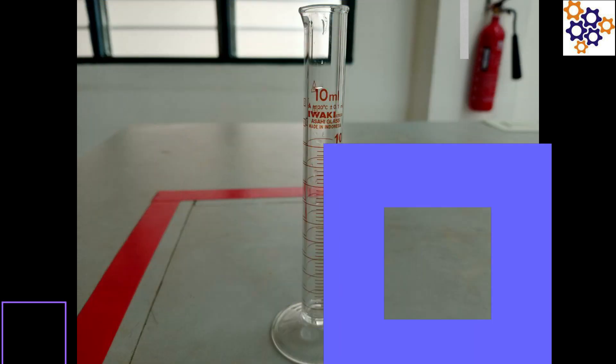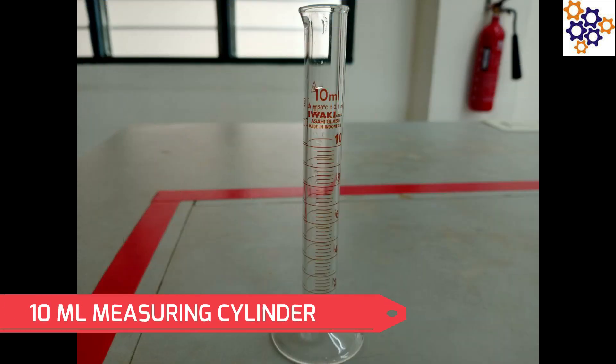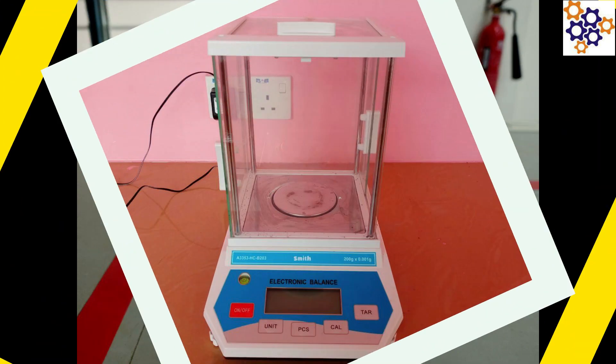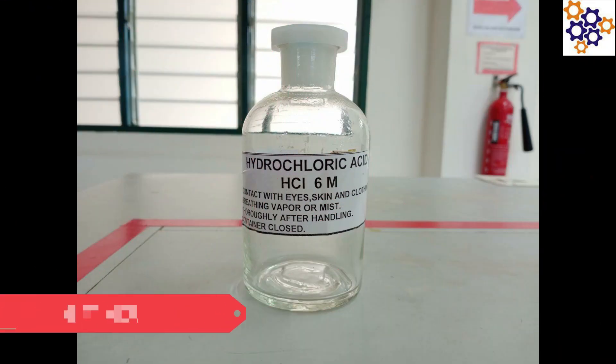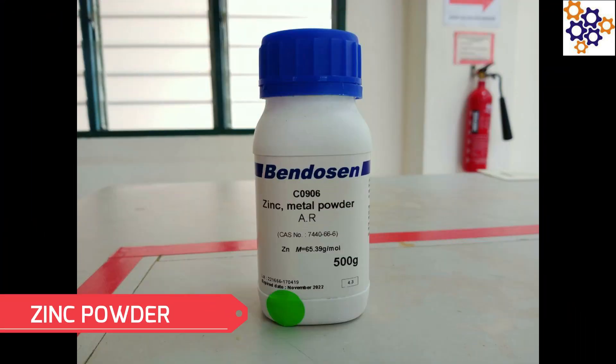10 ml measuring cylinder, analytical balance, 6 ml hydrochloric acid, and zinc powder.